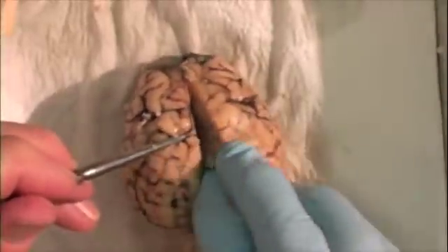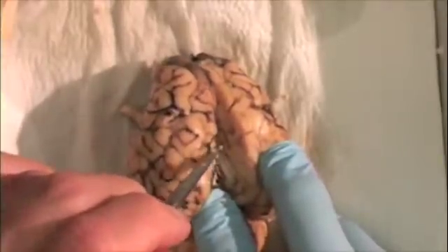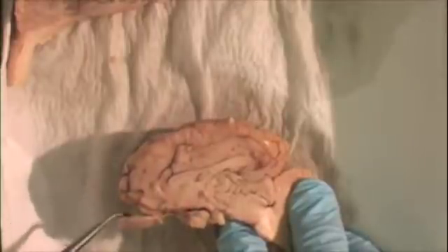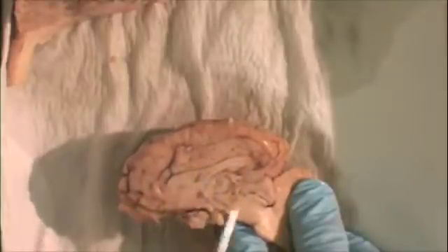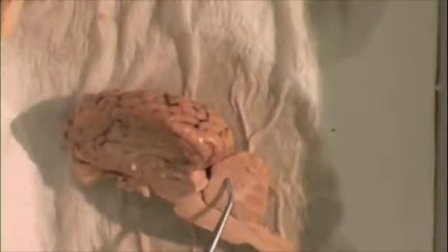If we probe down into the longitudinal fissure, we'll come to a massive band of white matter, the corpus callosum, connecting the left and right cerebral hemispheres. In this sagittal view, there's the olfactory bulb, a gyrus called the cingulate gyrus, and there's the corpus callosum. If we look at the cerebellum, we can see the white matter inside — the arbor vitae.